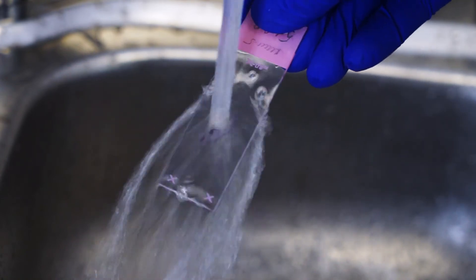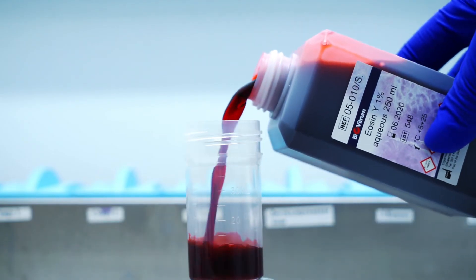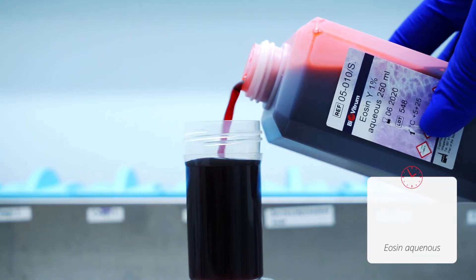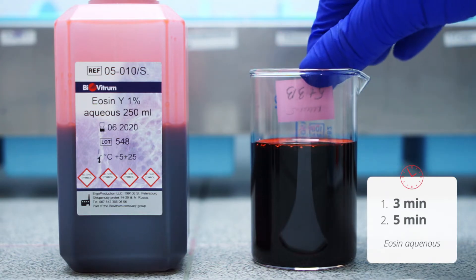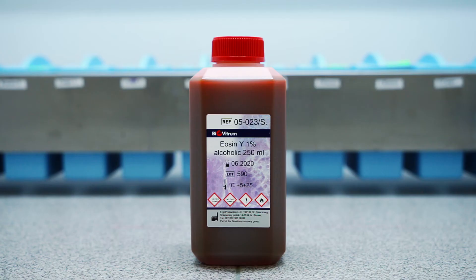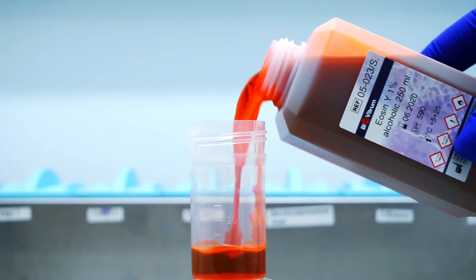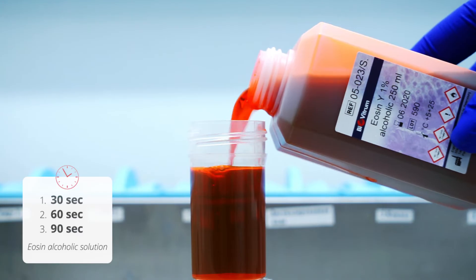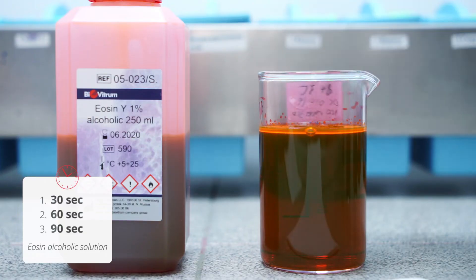At the next stage we stain the slides with eosin. We use an eosin aqueous solution, keeping the preparations for 3 and 5 minutes respectively. In eosin alcoholic solution, the staining lasts for 30, 60 and 90 seconds.